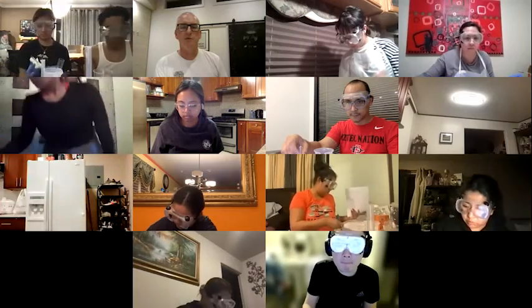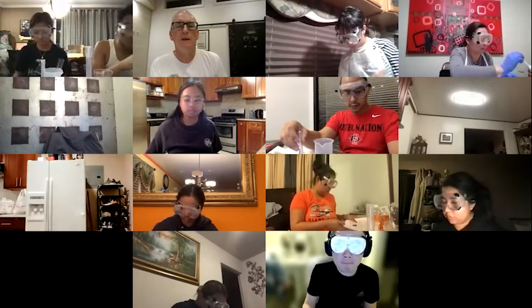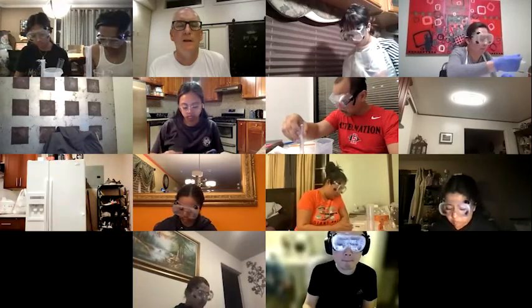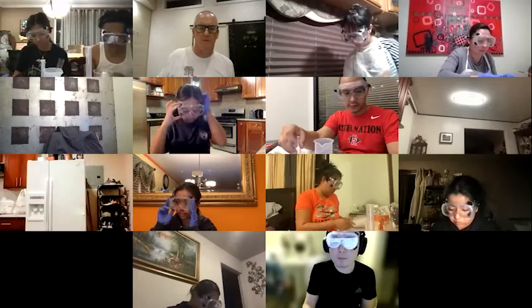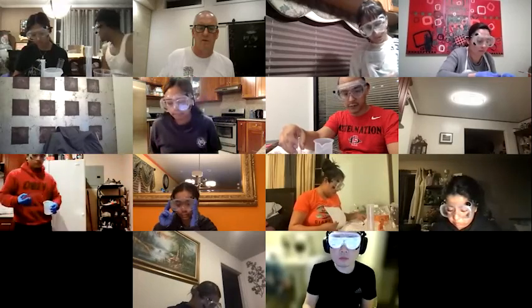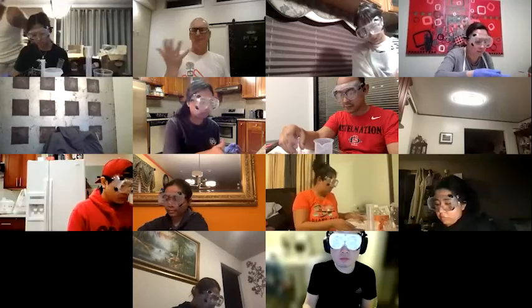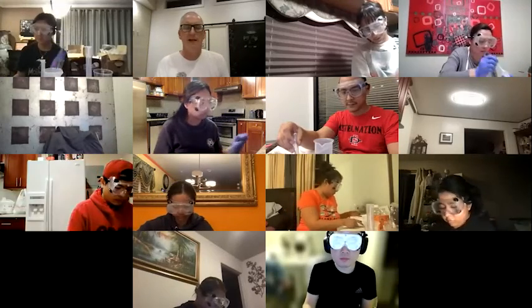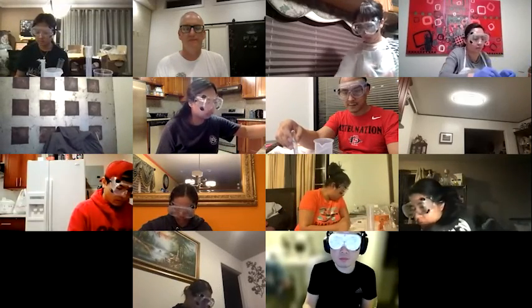How you doing, Renee? Which one are you working on? I think it's 5. Which one's 5? Holding the glass tube over the candle. Oh, right. Okay. Yeah, that one. I mean, basically, if you hold it too close, you're just going to get it all filled with soot.